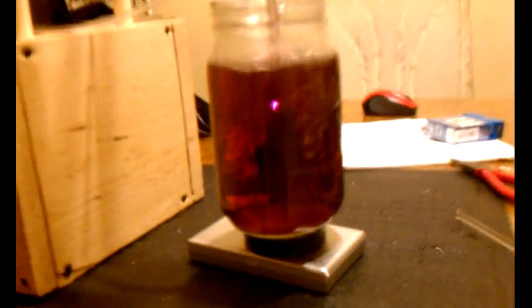Alright, quick update. See the color starting there. Beautiful, beautiful color. This batch I think I'm going to be extremely pleased with. I've been running for I don't know, close to an hour. And we can see it's just a small spark actually, a nice little red color for that spark, not a big blue.